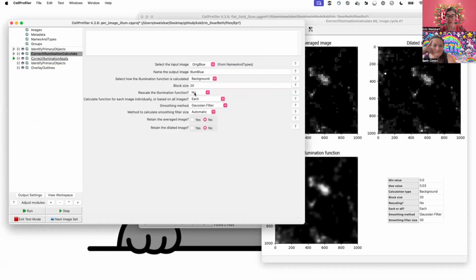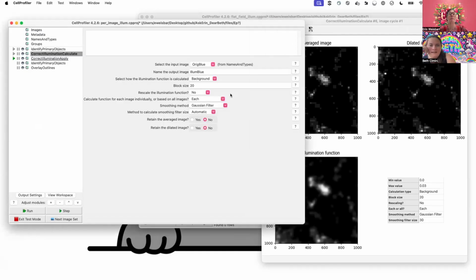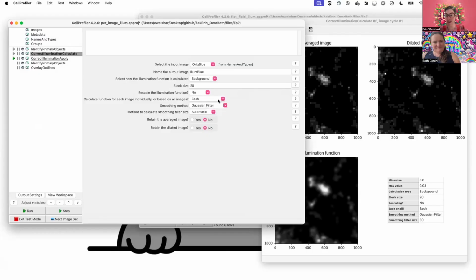I don't want to rescale this because I'm not going to be dividing the images. I'm just taking this extra bit of signal, which you see here ranges from 0 in my background to 0.02-ish in my brightest areas. So that is the scaling I want because I'm going to subtract this illumination correction, not divide it as we did in the other example. This is about light that is added to my stuff that shouldn't be because it's maybe out of focus. And so to get rid of it, we're subtracting. Yes, absolutely. Thank you. Great way to put it. So again, empirically, you can test different ways of going from this blocked image to a smoothed image. This is a starting point.